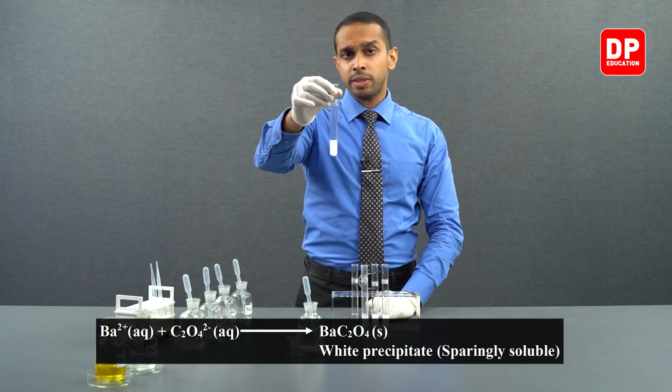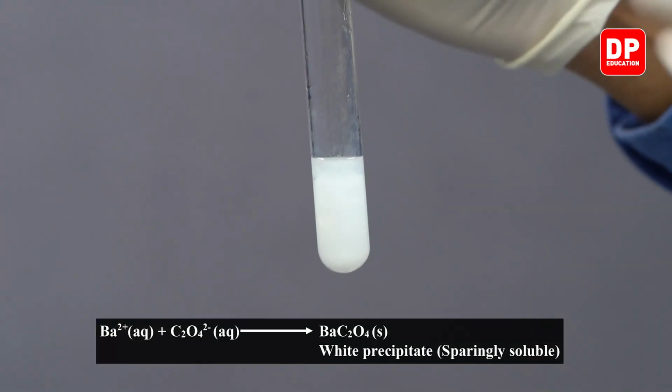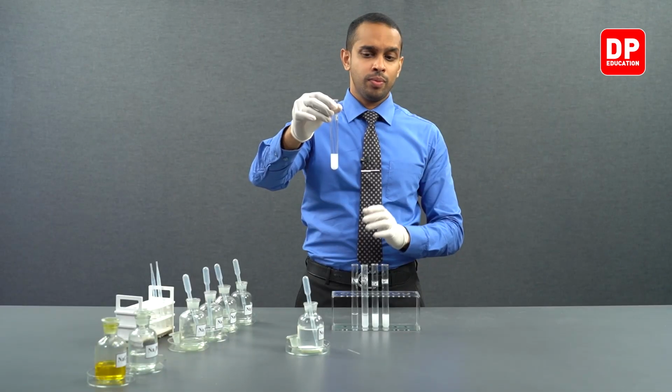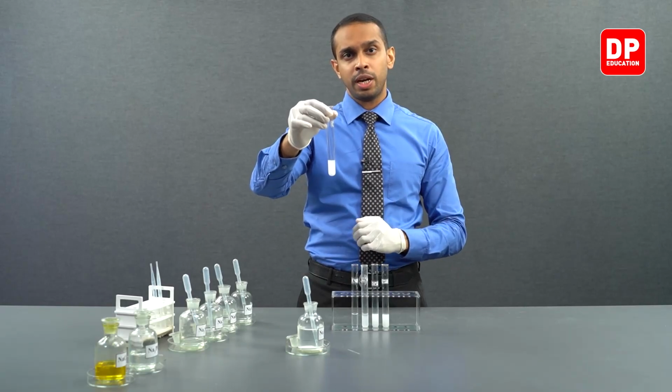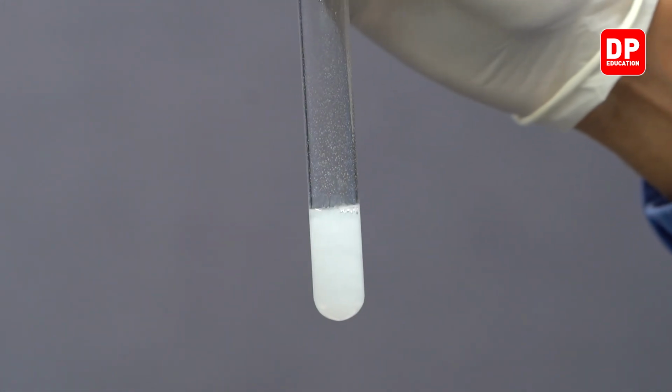Barium 2+ in the presence of oxalate anion will form barium oxalate, a white color precipitate. Barium oxalate is a white color precipitate which is sparingly soluble in water. You can see the color very clearly.